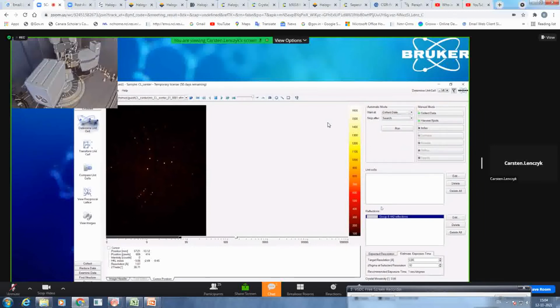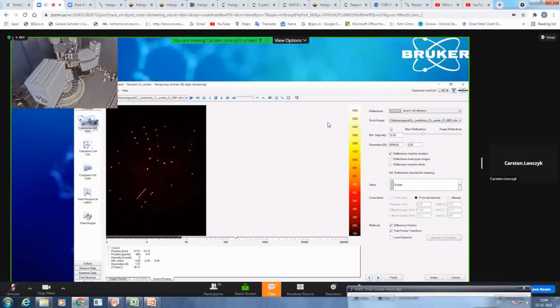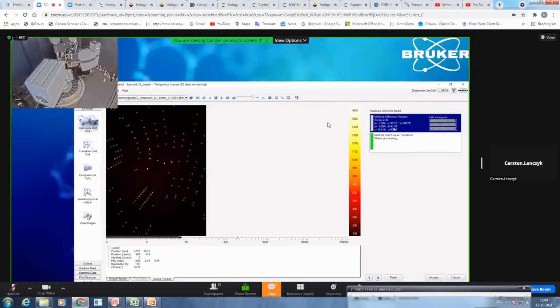So to get a good first estimate, I would always try to get at least more than 100 reflections. So you would now go to index. We want to take the same criteria as for harvesting into account and go to all the resolution range it will suggest here. We have different methods for searching the unit cell. We take the default values. Most of the time, in over 90%, they are totally fine.